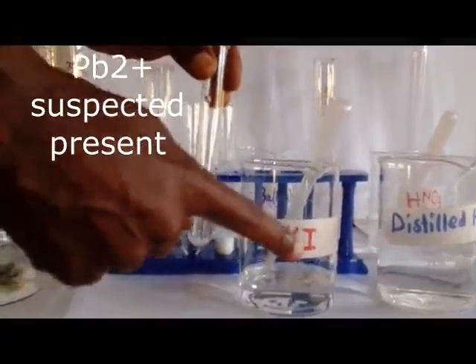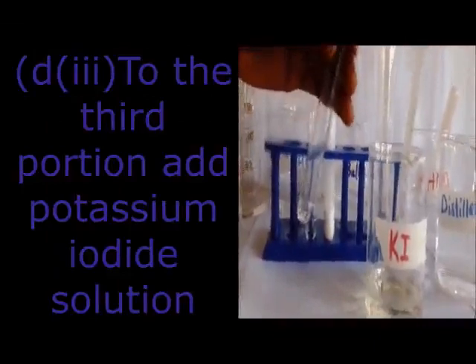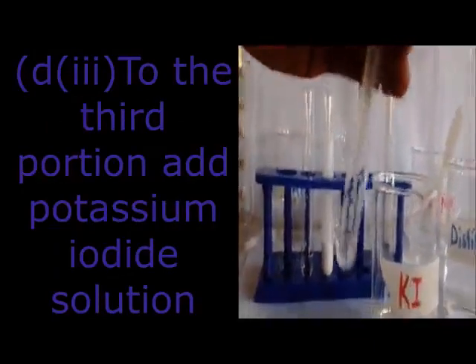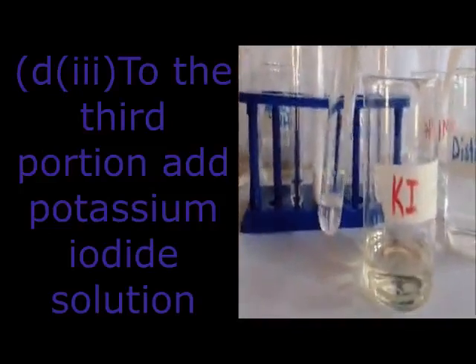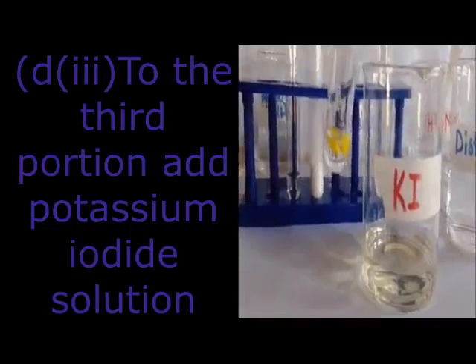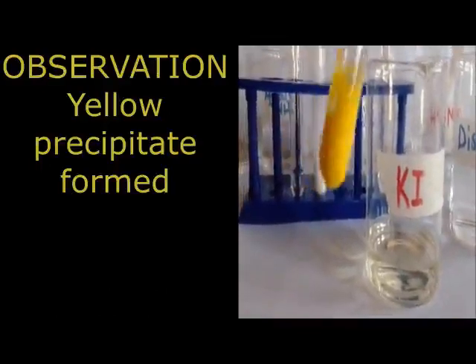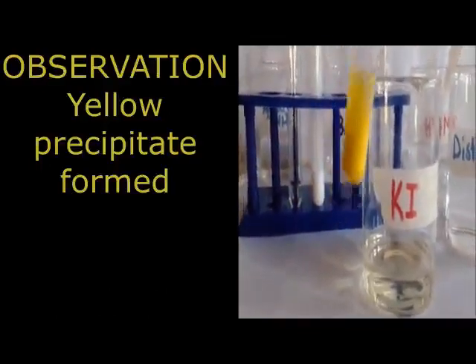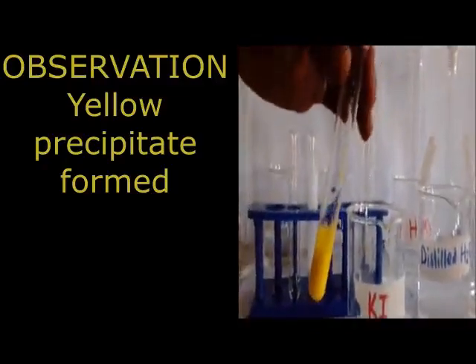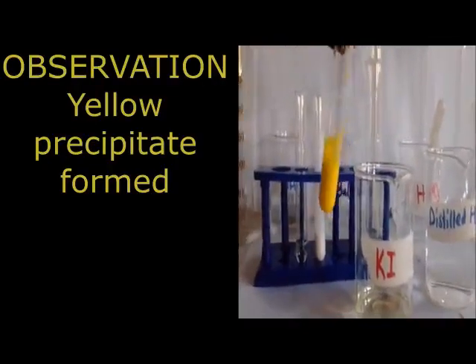For the next test, we are going to add potassium iodide. This is my potassium iodide. So my third test, I'm going to add potassium iodide to my third portion. I put my drop of potassium iodide, then I transfer. When I'm transferring, be careful, don't just add anyhow. You can see I add my first drop, it brings yellow. Add the second one, add the third one. There we go.